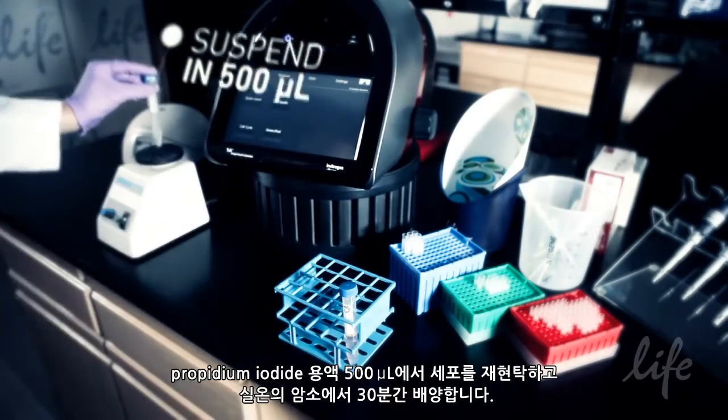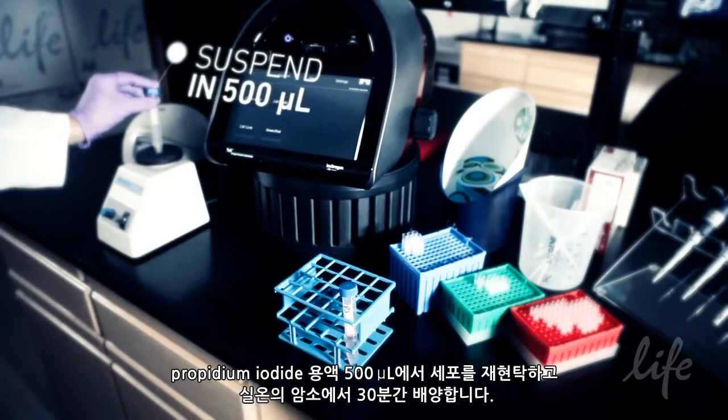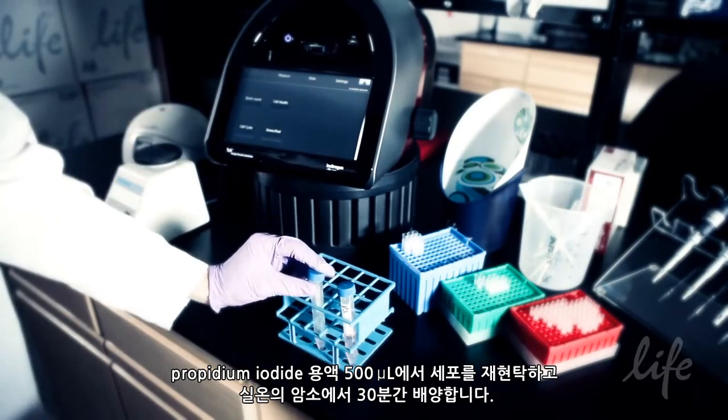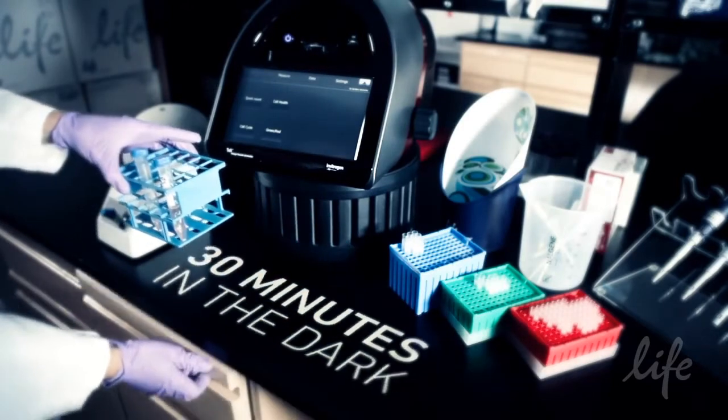Re-suspend the cells in 500 microlitres of the propidium iodide solution. Incubate at room temperature in the dark for 30 minutes.